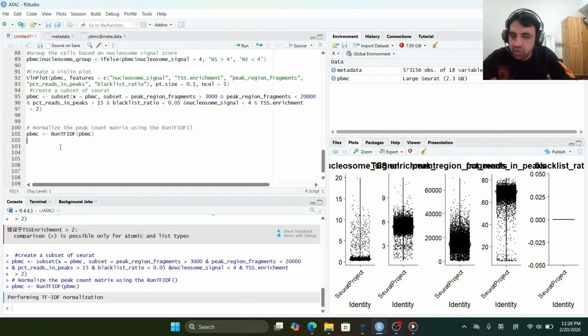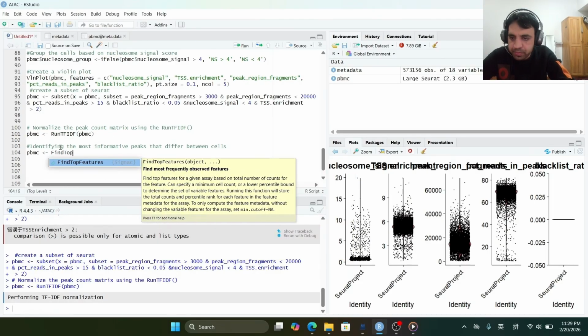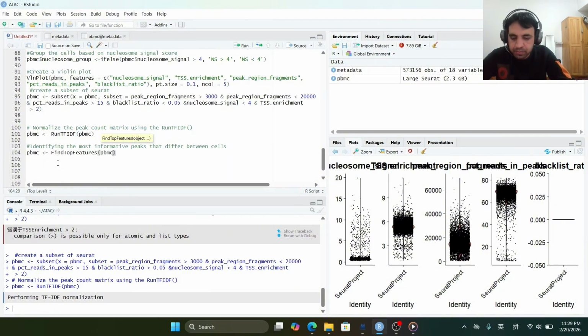Now we will identify the most informative peaks that differ between cells. So pbmc, which is our Seurat object, and we will use the find top features function. The key parameter includes the min.cutoff q0. You can change the value of q according to your hypothesis, but we will keep it 0 because we want all the features. So run.